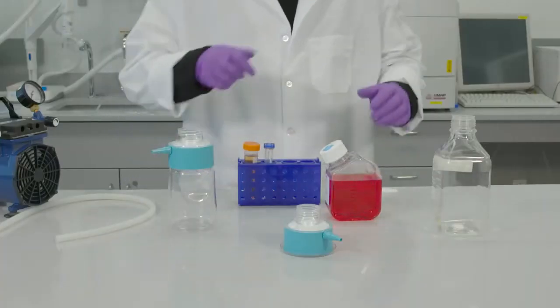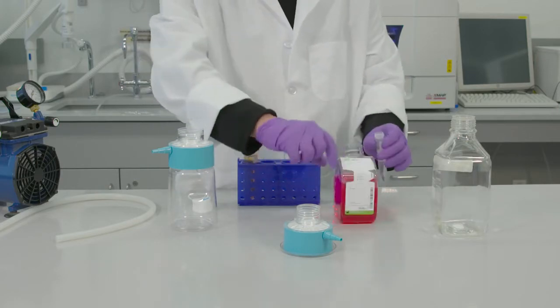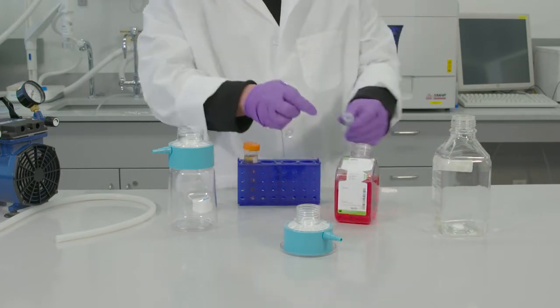To prepare and filter media, first add all additional components to your base media bottle prior to filtration.